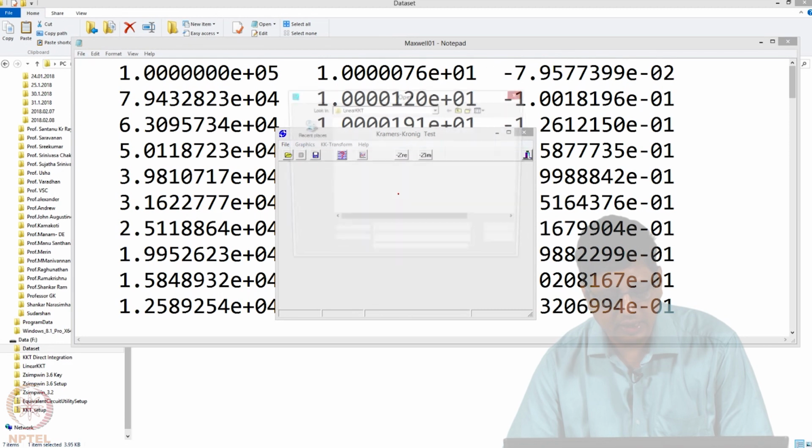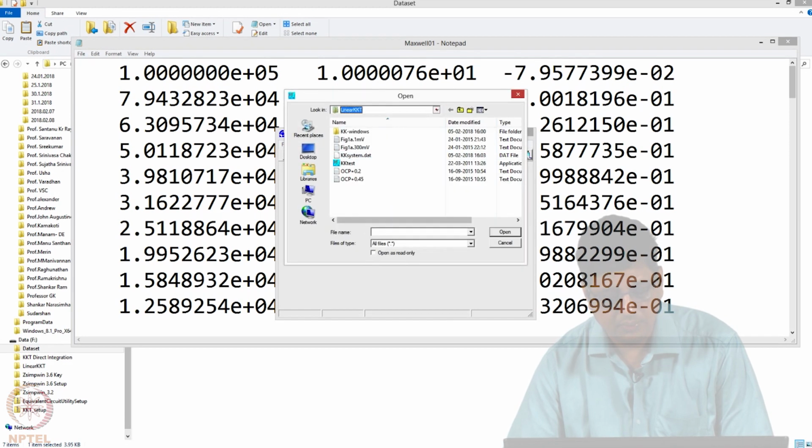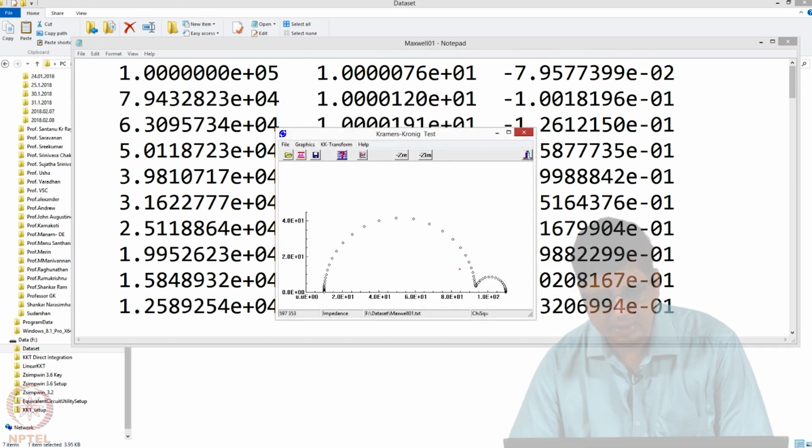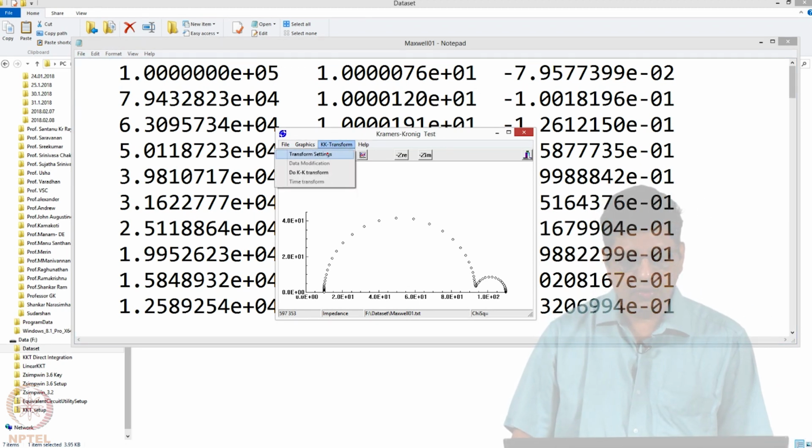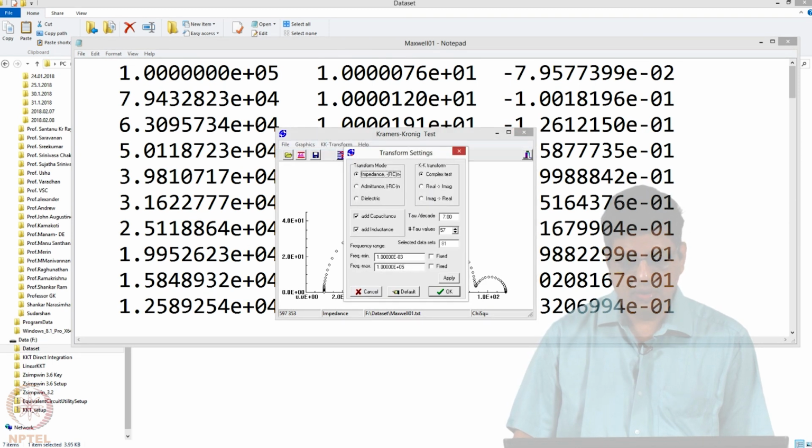So we are going to take that, I will take one example. You can see this is showing you two loops here and you can go to the transform settings. We want to transform this in impedance mode. You can leave this checked. If necessary, it will add a capacitor or inductor. It works only in the complex test. It does not work for whatever reason. The software is not geared towards making this.